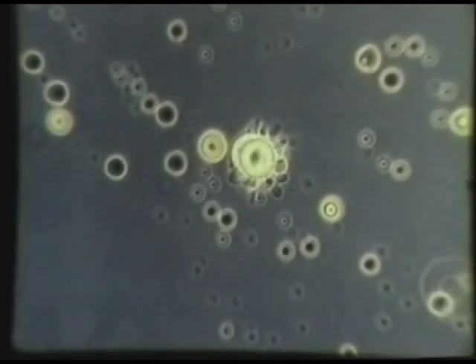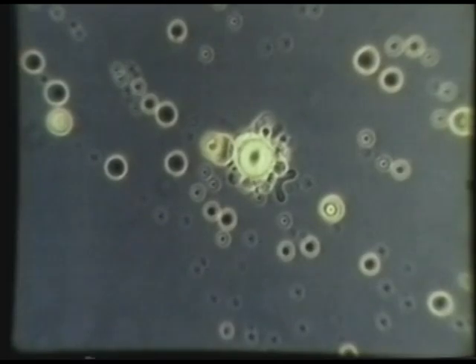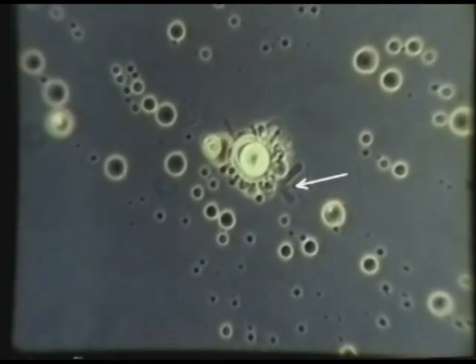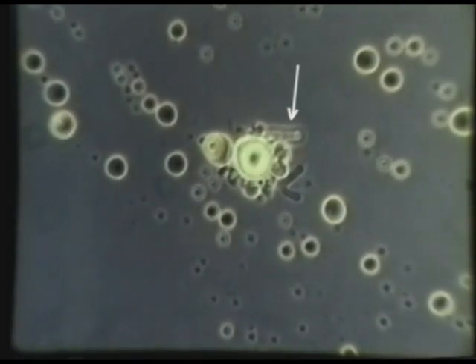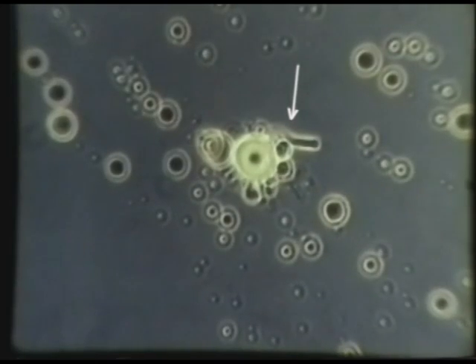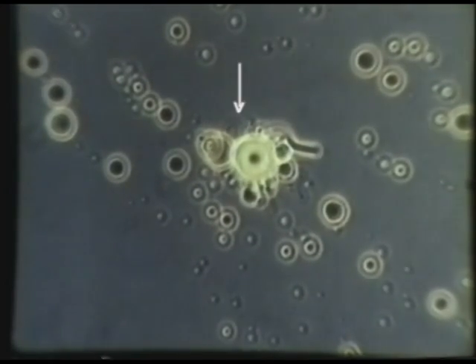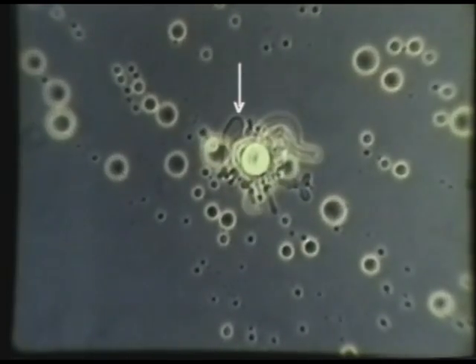Thin-walled structures sometimes project from large droplets as tubules or strings of vesicles. Tubules are now appearing at the lower right margin of the large lipid droplet. A dark serpentine structure is extending outward from the upper right margin of the large droplet. A broad, thin-walled structure with a wide aqueous space is developing at the upper left margin of the large droplet.